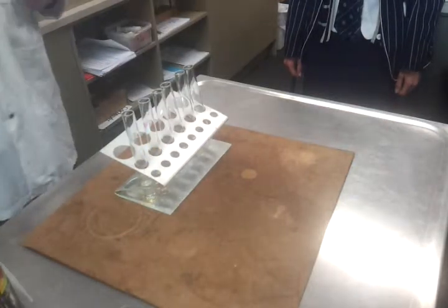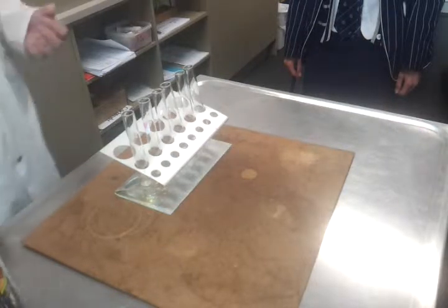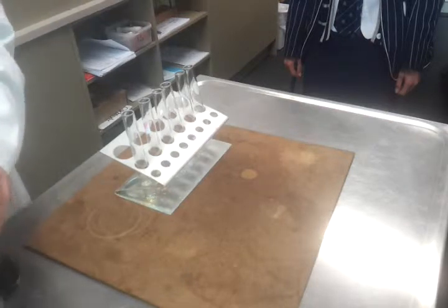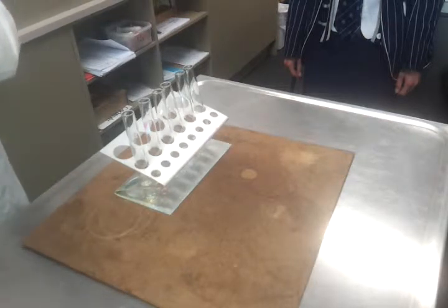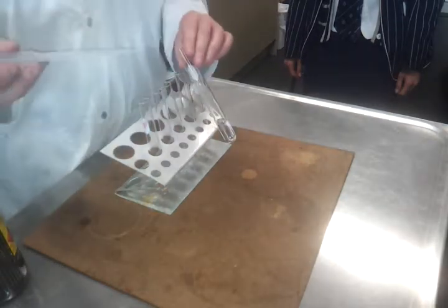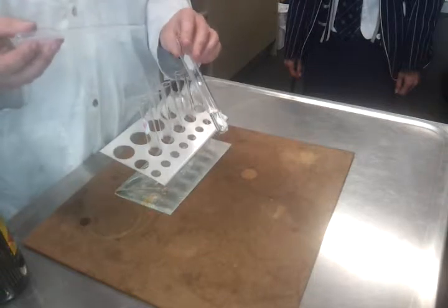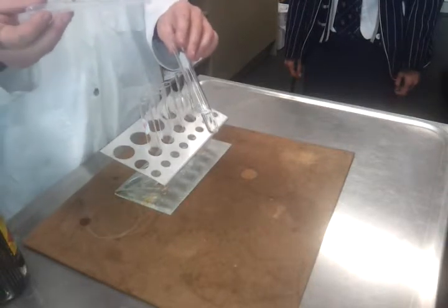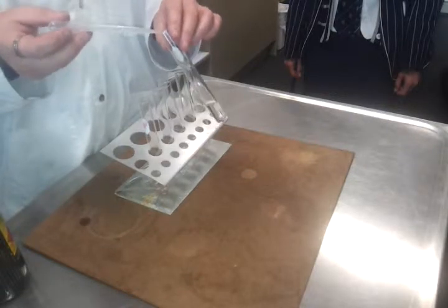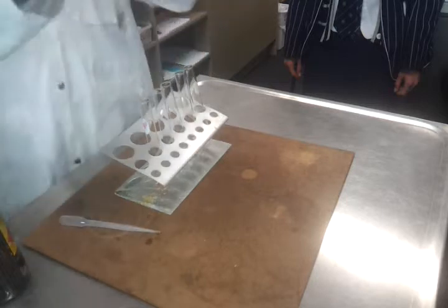So the alkanes don't have particularly exciting reactions. In fact, you're going to find this is quite short and sweet. But we do need to be able to justify what we see. So what I've got here is the cyclohexane. And first of all, we're going to see if it will dissolve in water. Things that do dissolve in water appear to just be one substance. If they don't, then they go cloudy, like a precipitate, so that's a suspension, or they sit on top. So what I'm going to do is put it in and then shake it and see what happens.